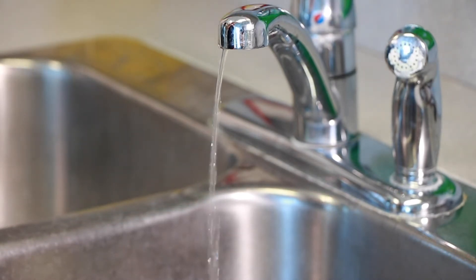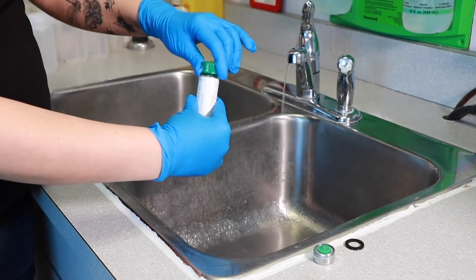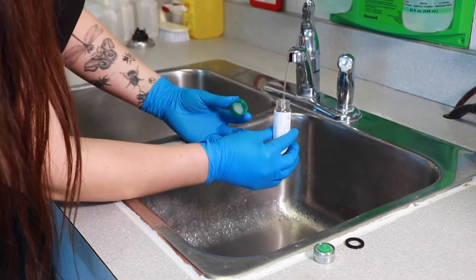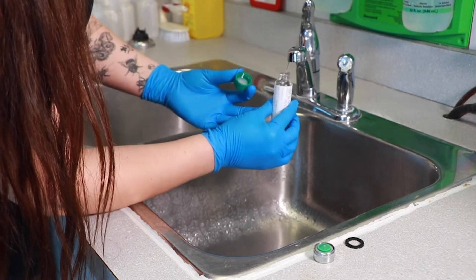Make sure the water is cold before sampling. Put on gloves to protect yourself from acid splashes. This is the tricky part: fill up the vial slowly until it makes a dome shape at the top, above the rim of the vial. Be careful not to spill any preservative while sampling. Wet the lid and screw it on the vial.